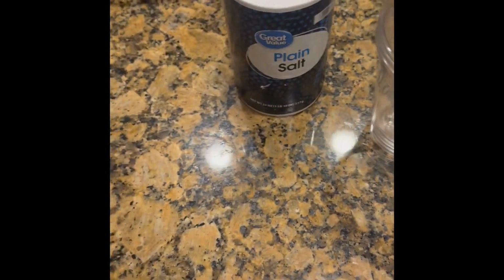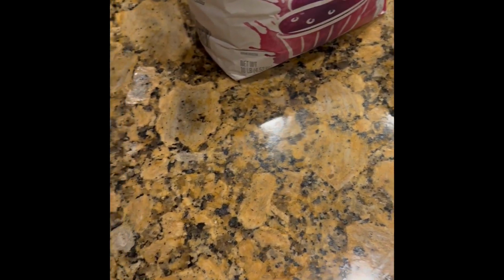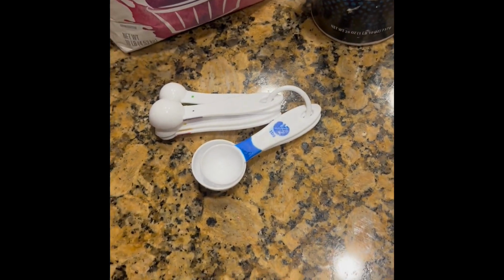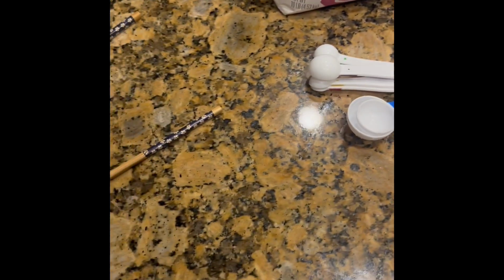The materials being used for this experiment will be 1, 2, 3. I know it's hard to see because they're clear, but there's 3 of them. We're using 3 cups. We're using some salt, some sugar. So the salt will be for our salt solution, sugar will be for our sugar solution. We have a tablespoon for measuring the solutes, and a chopstick, which I'm going to use to mix the water and the solute for the solution.